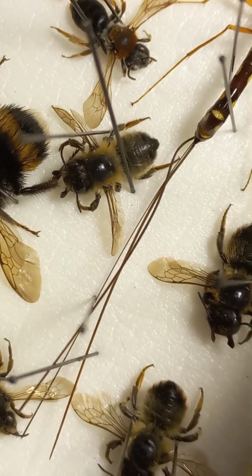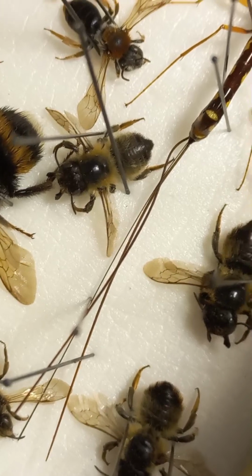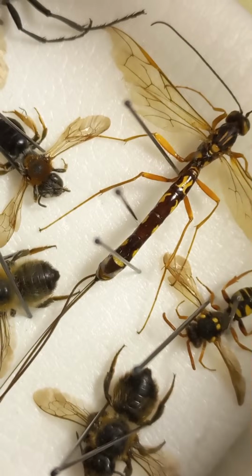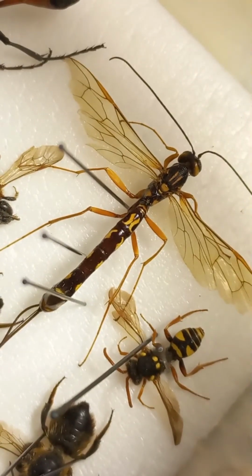Ovipositor containing several sticks, has 2 times, even more than 2 times longer than body size. So this is one of species of genus Megarhyssa, which is parasitic on horntail larvae developing inside a wood.